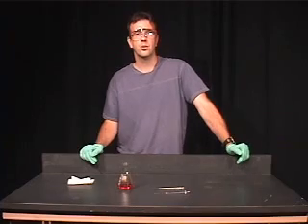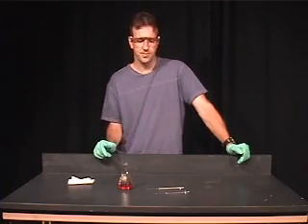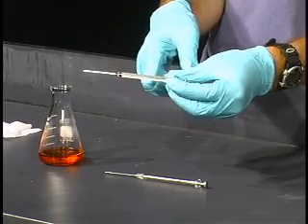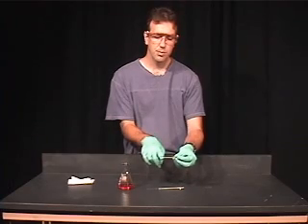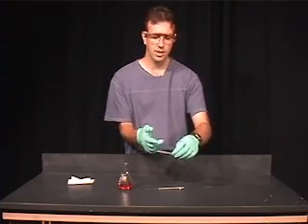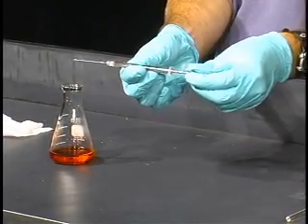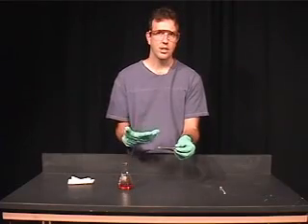I'm going to show you how to determine the volume of solvent that you need to add to the GC. We're going to be using a pretty accurate syringe, and I have two examples here. One is a ten microliter syringe, which has markings every one microliter, so you can measure down to the nearest 0.1 microliter. Due to the requirement for a close-up, I'm going to be showing you the technique using a 500 microliter syringe. The syringe has a glass outer coating, a metal plunger, and a metal-tipped needle.